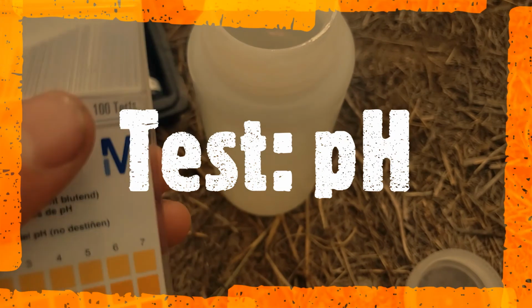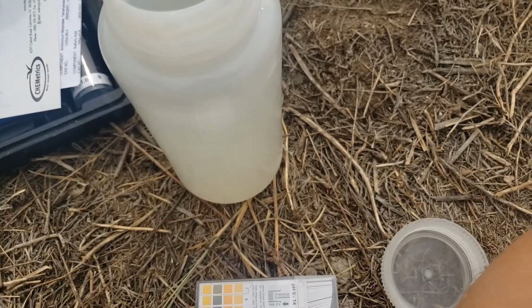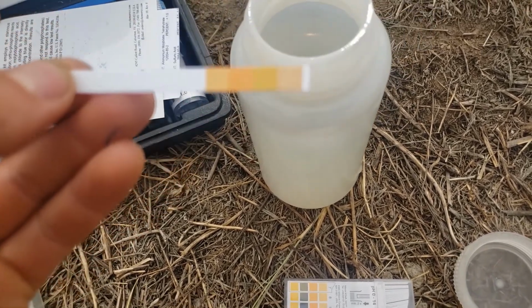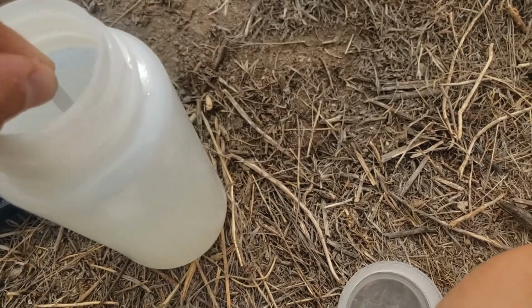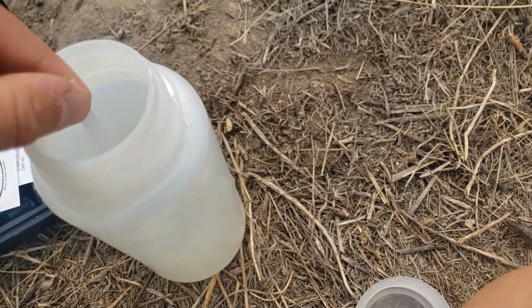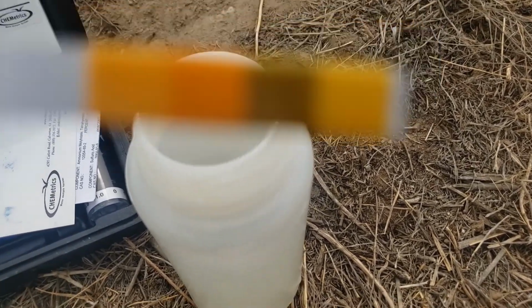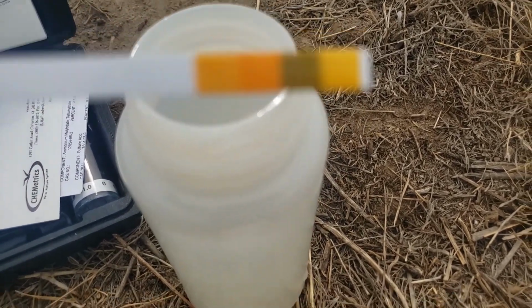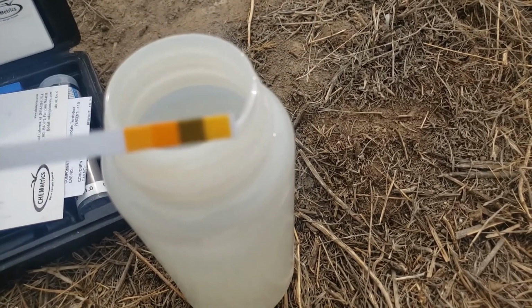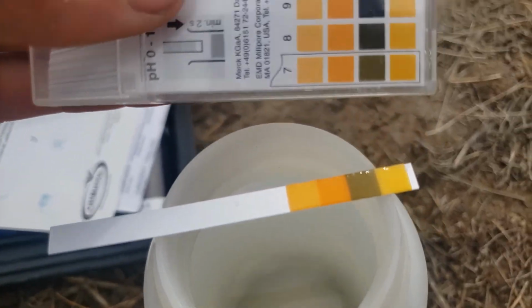So now let's go ahead and measure the pH. So I have my pH indicator strips. I'm going to take one out. And this is what I'm going to put in there, and it's going to change colors based on the pH of the water. Okay, so did you notice that color change? Kind of hard to see on my camera.